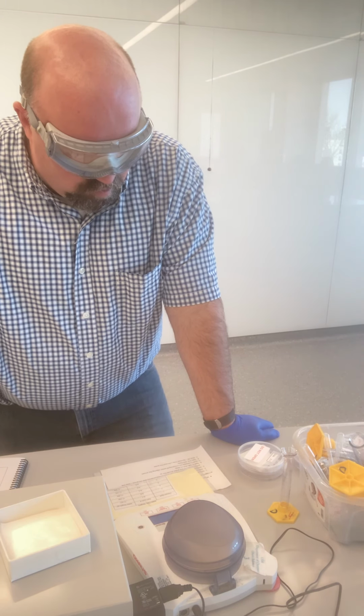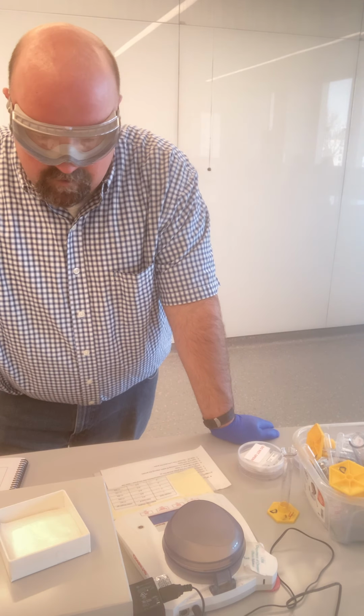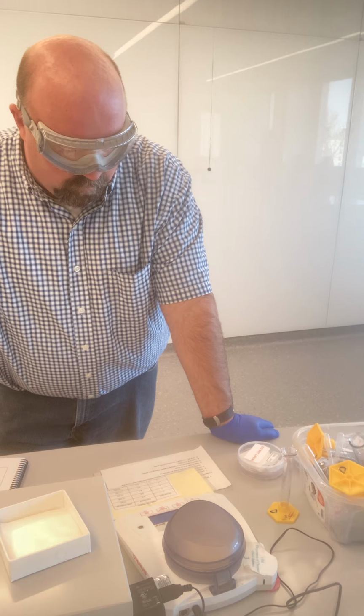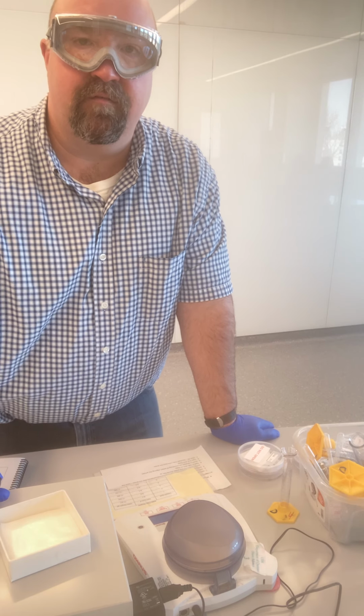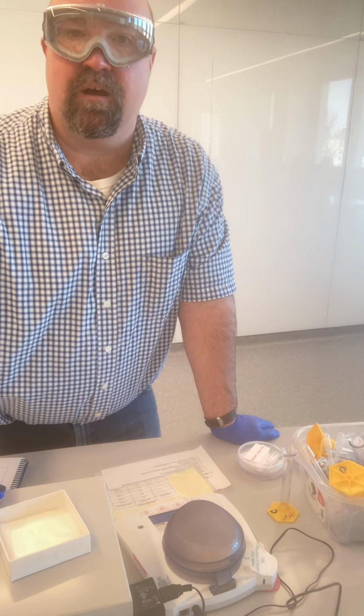Those are just some visual observations, but you will of course do the actual calculations to find the total suspended solids of all of those. That will be provided in the data spreadsheet for you in order for you to find the total suspended solids of sites 1 through 5. And that concludes the TSS portion of Module 1.